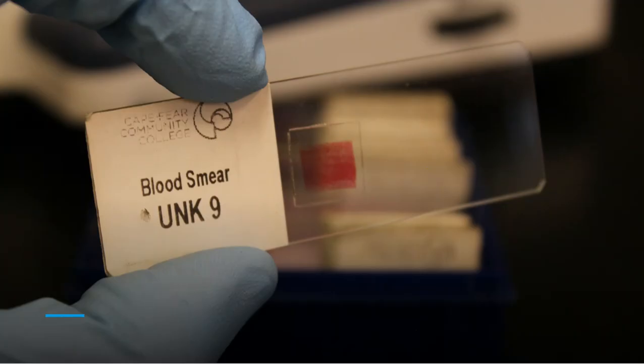All of these blood slides will be very similar. It will just be one microscope slide. Again, we'll have the unknowns listed here, and this tag will often go to the left-hand side. That's the way that we've put the stickers on them. And once more, you will see the word top written above the blood smear in the lab when you get there, so that should face up on the microscope platform.